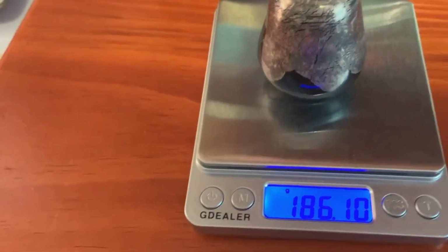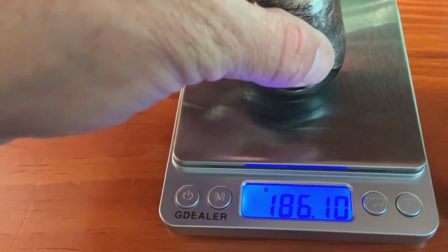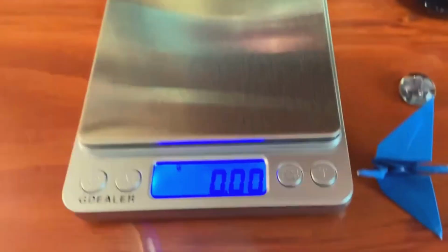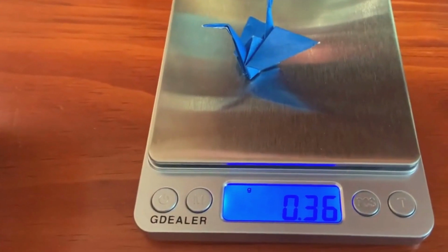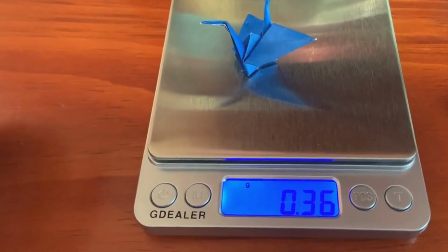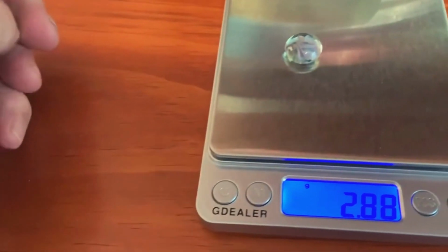So what you're going to do is simply place one of the objects on the balance, read it, write that down in your data table, and then take it off, and then place one of the other objects on the balance. Okay, and you're going to again read it. Wait till the numbers stop moving, and then go ahead and put the third object.